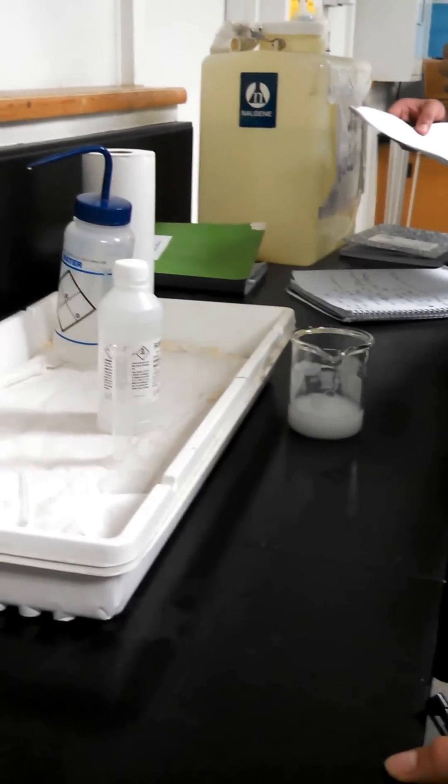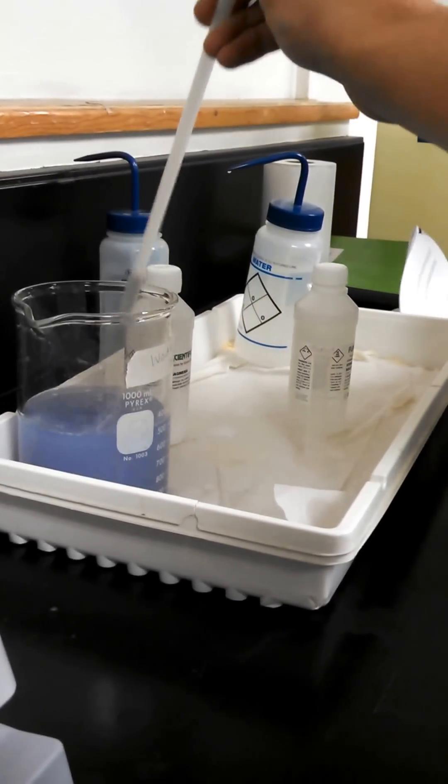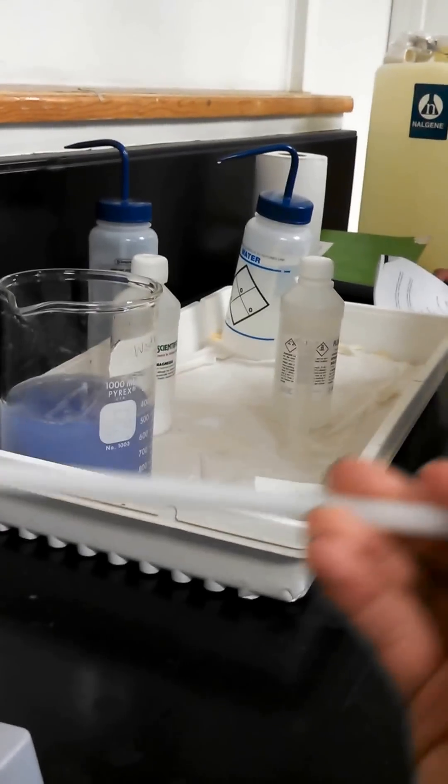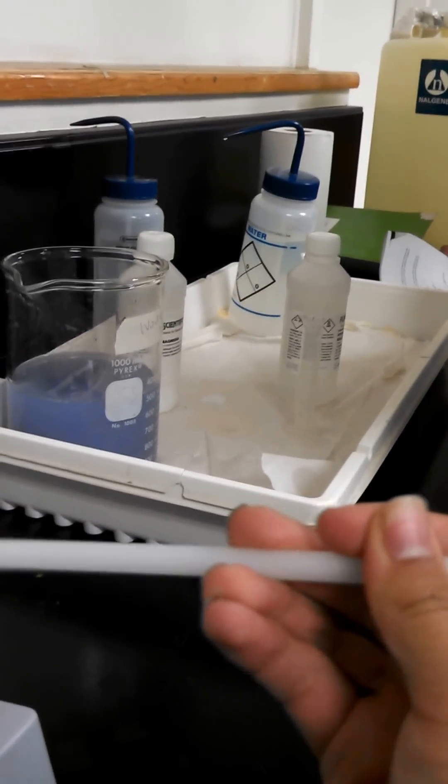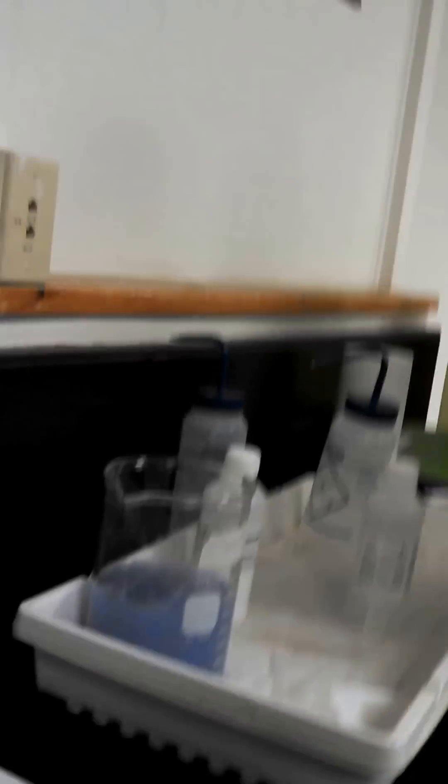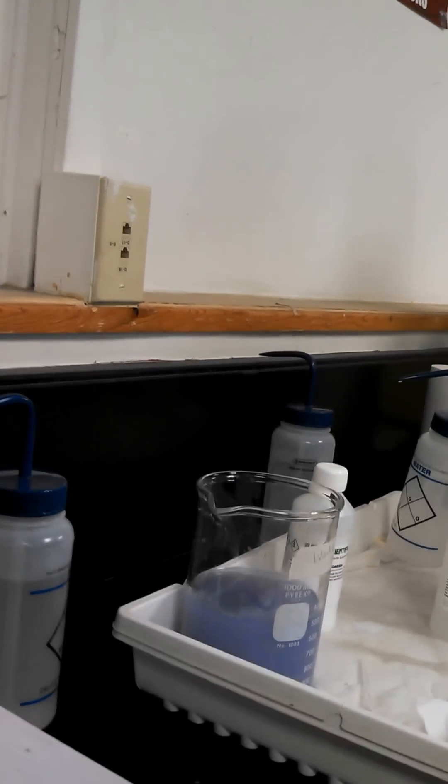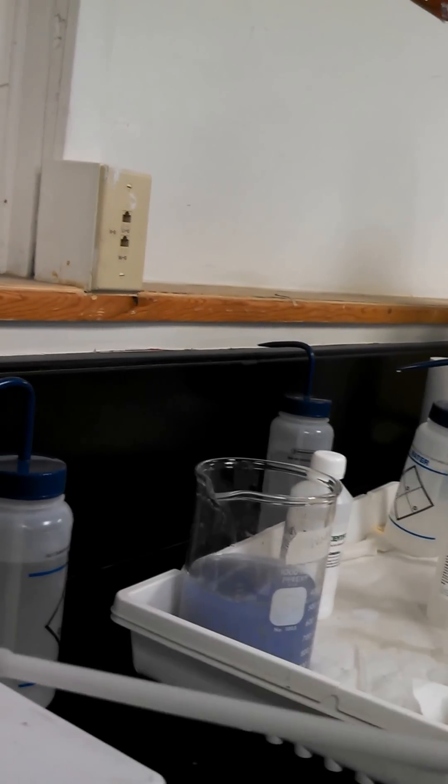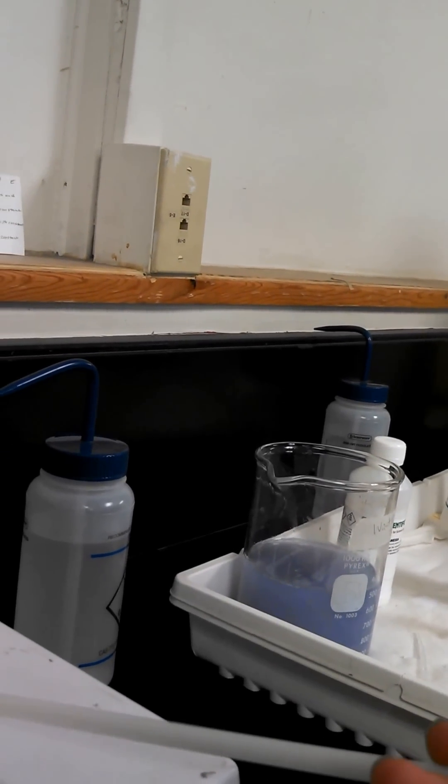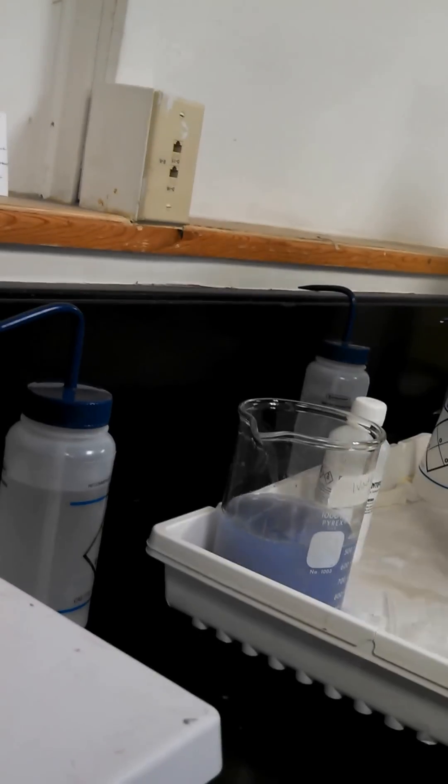So this thing probably just has a magnet that spins around. The pH test, really? Now it multiplies. I'm kind of curious. No, don't do it again. Because it's basically just a magnet. That's cool. That is cool. I just want to see how strong ten is to make sure we don't break anything. Oh my gosh. Don't turn it to ten when we're stirring that. I don't think you should do that. Yeah, it just goes faster. It's not stronger.